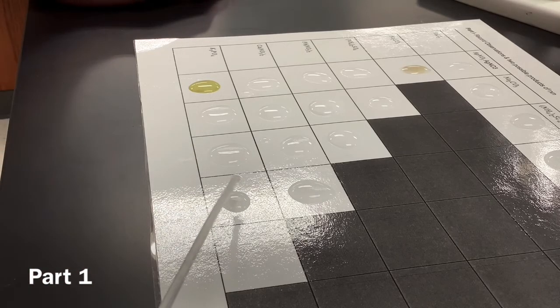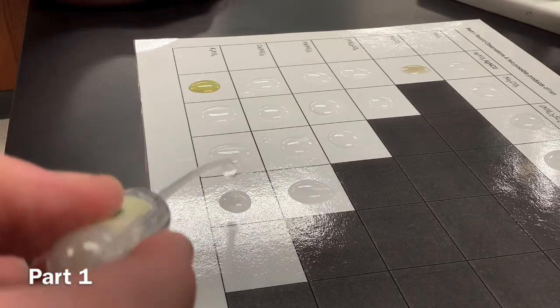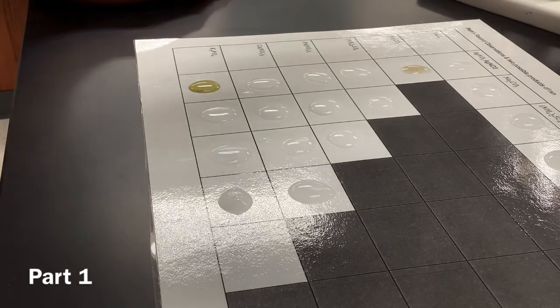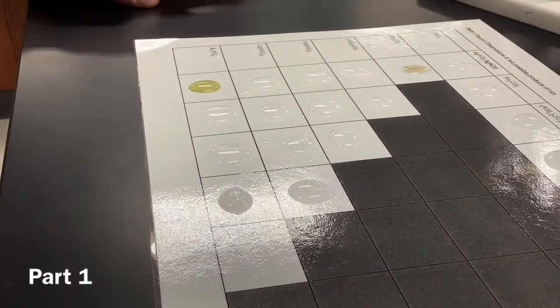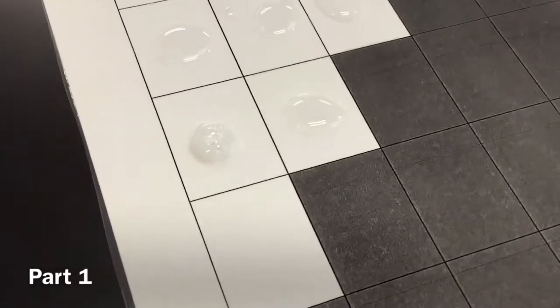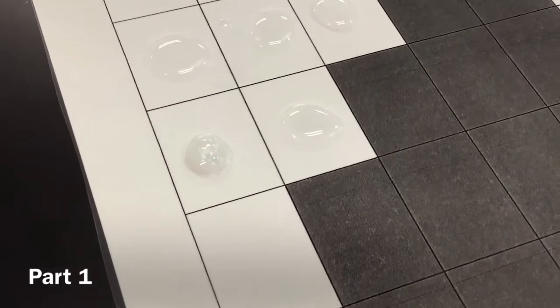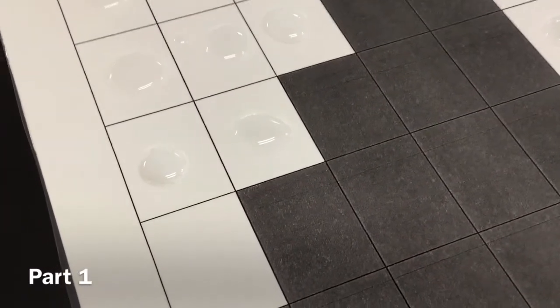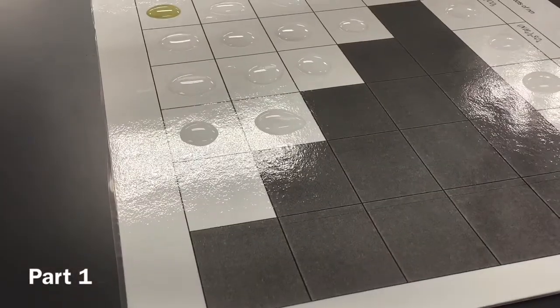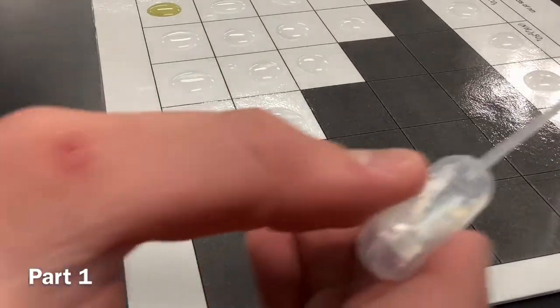There's actually very similar chemicals. Do something. Oh no, it's actually doing something. It is, everyone. Oh my gosh. Guys, everyone, it's cloudy. Wow. Clouding up. Pure excitement. Yep, they can see that one is definitely cloudy. That's a good cloud right there. Yeah, that is a good cloud. Great cloud. Quality cloud.